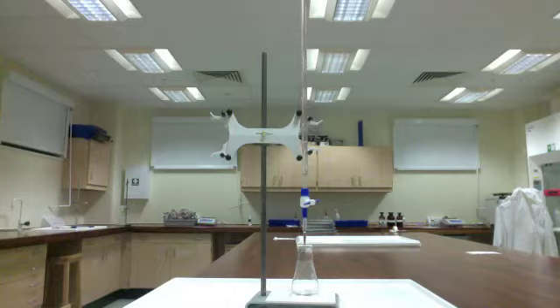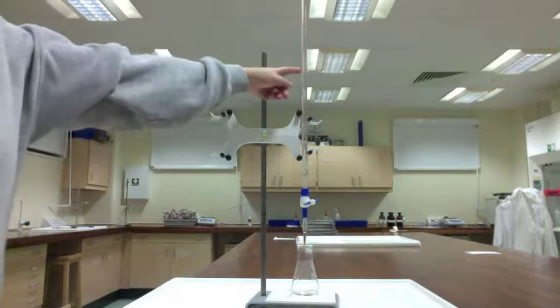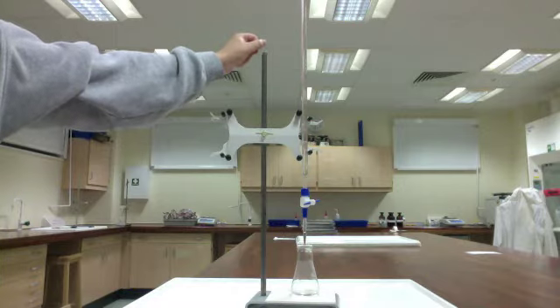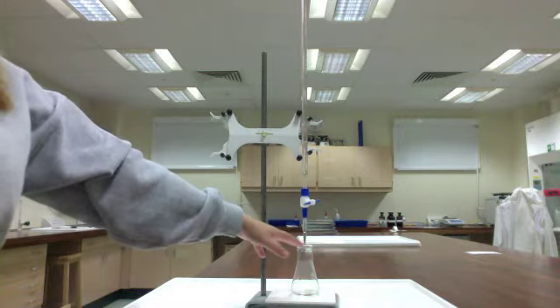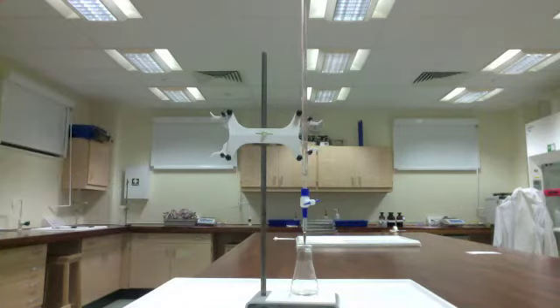So we have our retort stand, which you guys have seen when we used funnels for filtration. We have a clamp here that's just going to hold our burette in place. Underneath the burette we have our sample in an Erlenmeyer flask. It's really important to note that that's an Erlenmeyer flask and not a beaker, and when we get to the actual titration I'll explain to you why we use the flask instead.